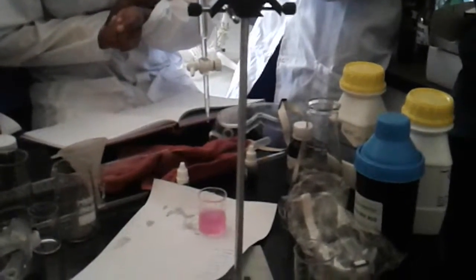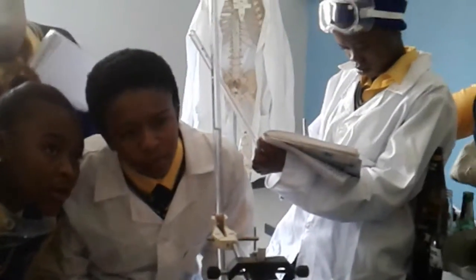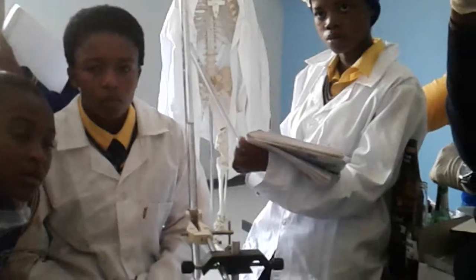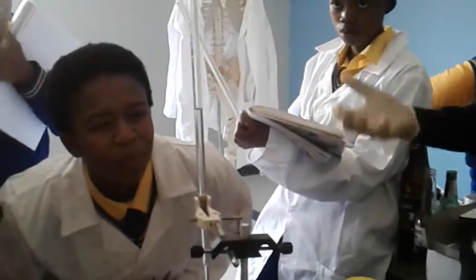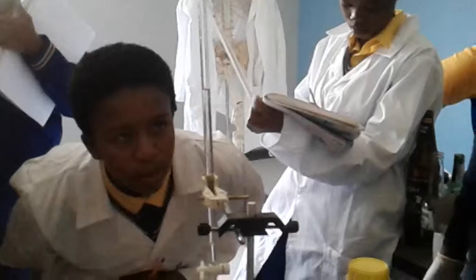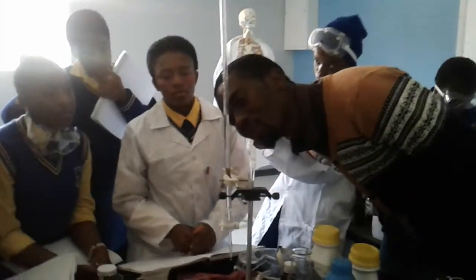Now wait. What is the volume that we used? From 0 to... No, guys, I said to look at the bottom of the meniscus. 13.9?